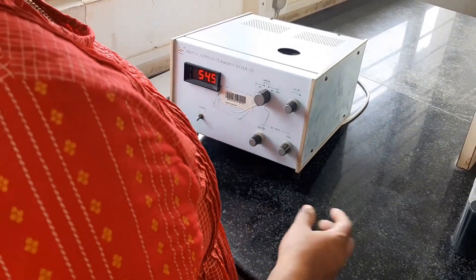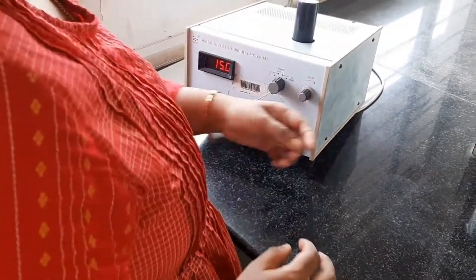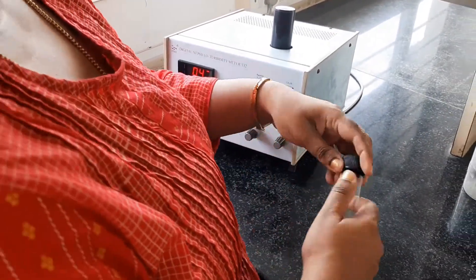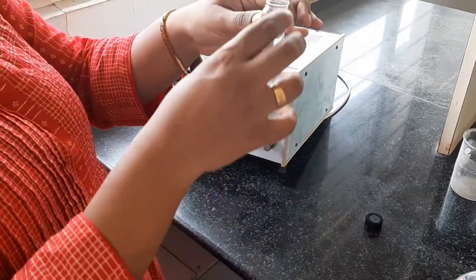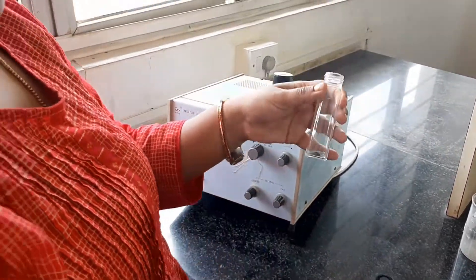I have switched on the power. There is a light source — always it is shut. When you use this, make sure there is no water on the surface, because water on the surface in the presence of light means the dispersion won't be correct.